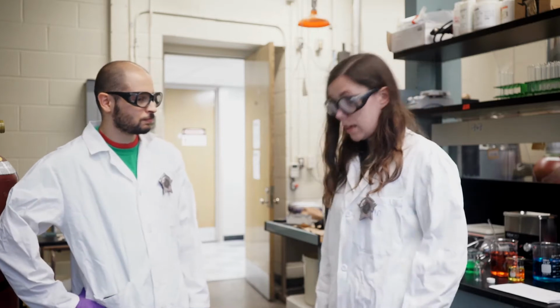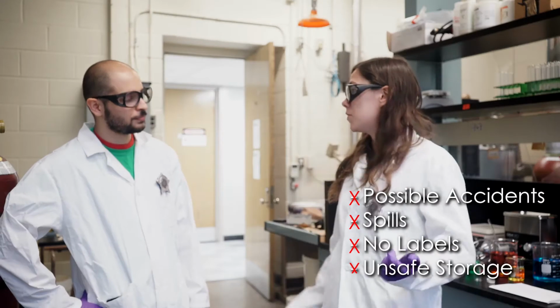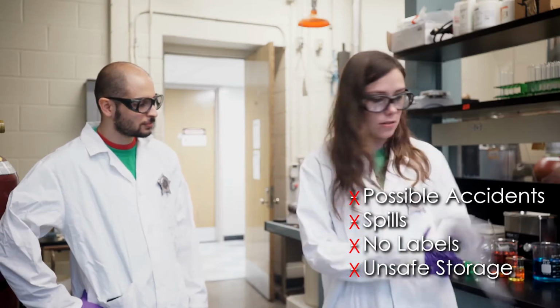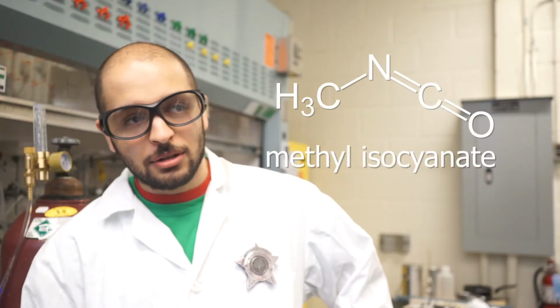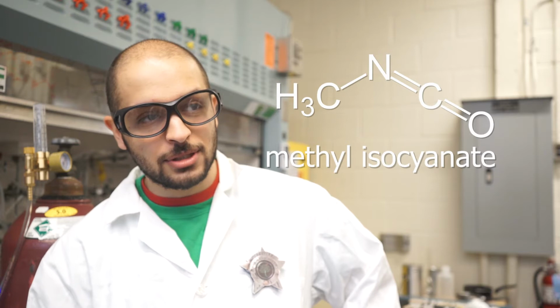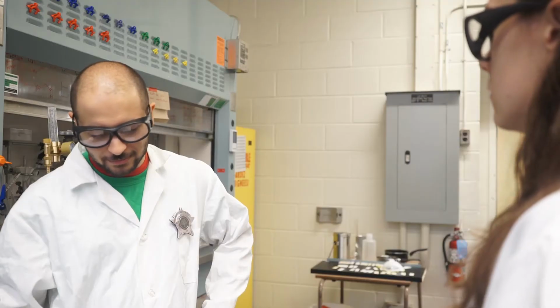Well, not only is this lab full of possible accidents, spills, and unlabeled solutions outside of the fume hood, I also found the synthesis that is rife with hazards. My god. This synthesis uses methyl isocyanate. Do they not remember the deadly and toxic release that happened in 1984? Thousands of people died when it was released into the atmosphere. Clearly not, or they wouldn't be using it today. Especially considering there's a safer and less toxic option, methyl formamide. This has to be stopped before somebody gets hurt.